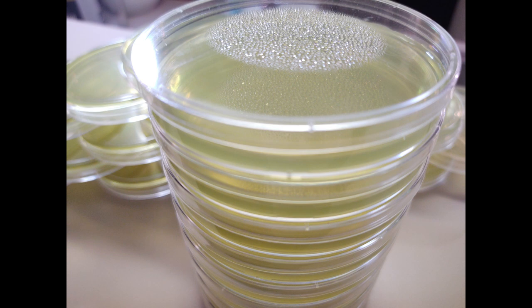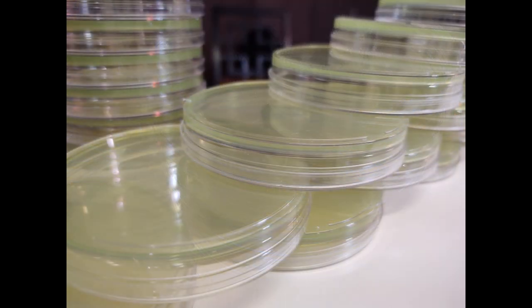Again, as a reminder, if you have any condensation, just flip your petri dishes or your jars upside down.